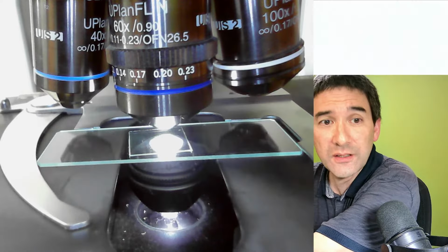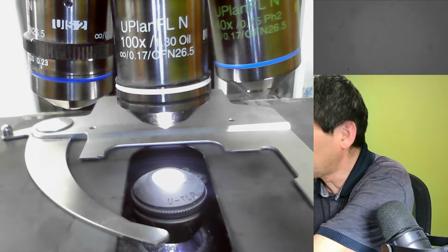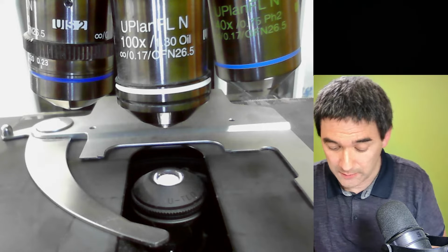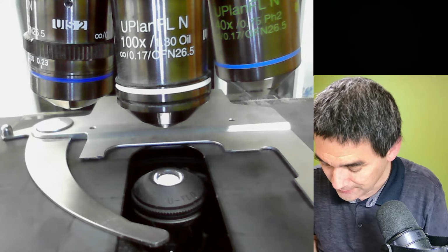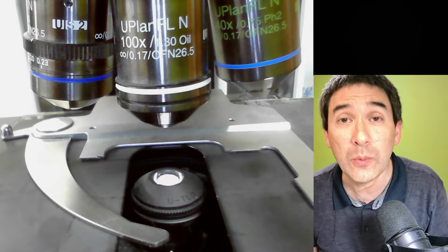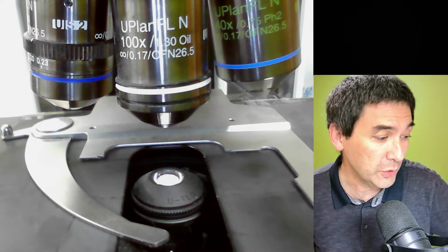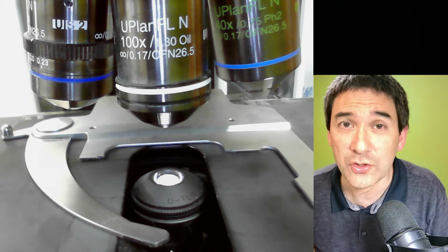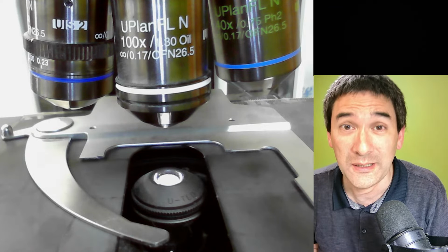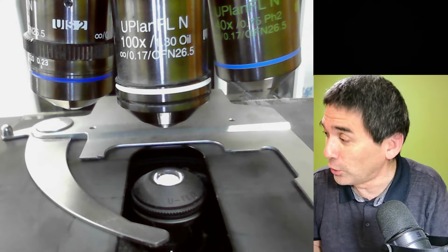Okay, so this is the 60 times objective, which I can just remove. For cleaning the objective, you see the philosophy goes apart a little bit here. Some people say you should not be cleaning the objective because you'll be using it every day anyway. If you're in a lab doing a lot of routine analysis, they say there's no point in cleaning it. You just leave it on there, especially if you're using synthetic immersion oil, then there is no danger of it solidifying. But I always clean it off.